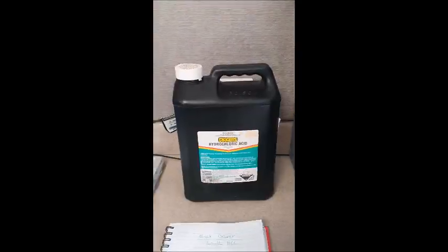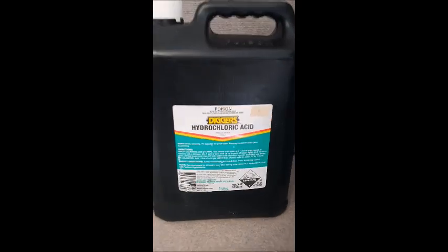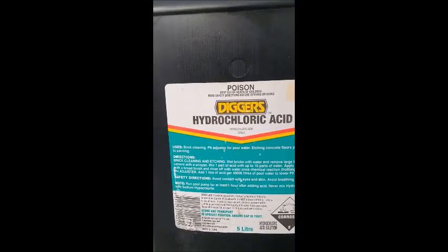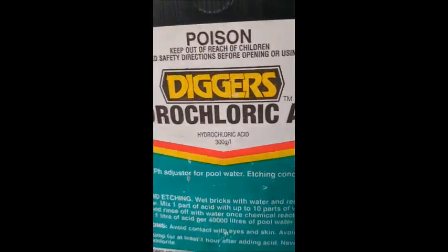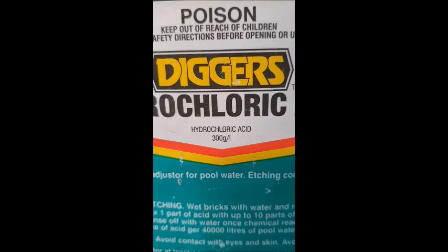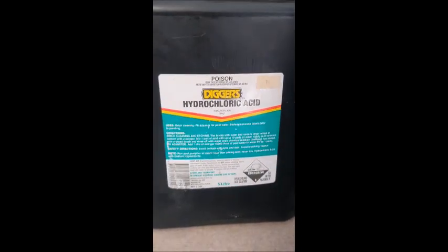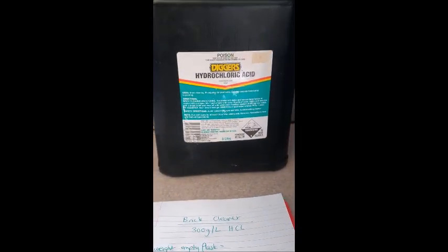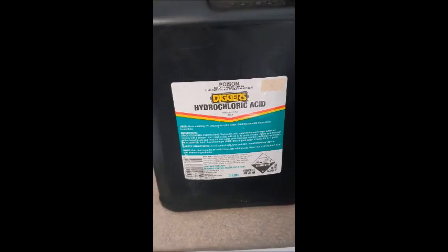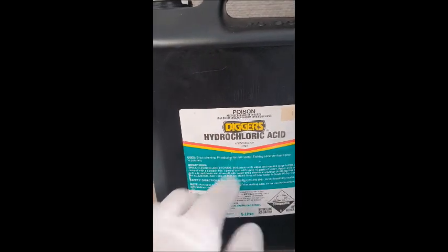I'll show you the container and you need to write down the concentration of HCl in this. So this is the brick cleaner we're using. You can see that is the concentration of hydrochloric acid that it is claiming. Now it's pretty old so basically we're going to test if that concentration is accurate.